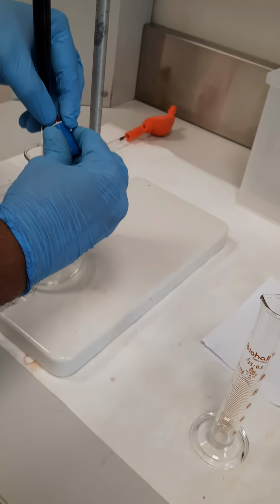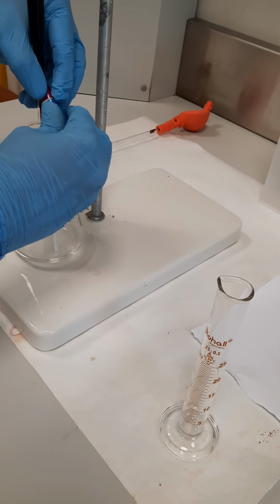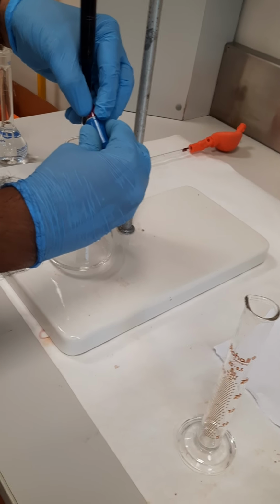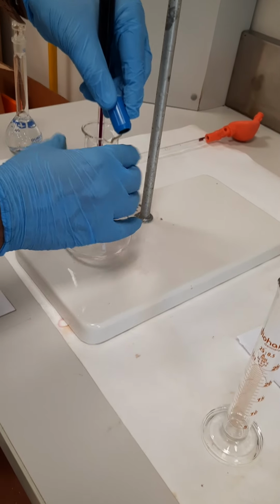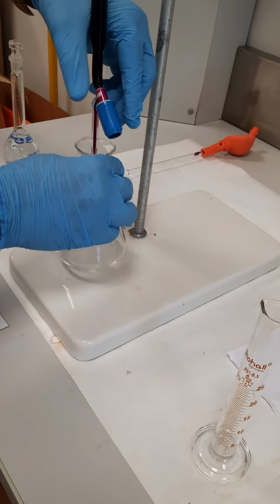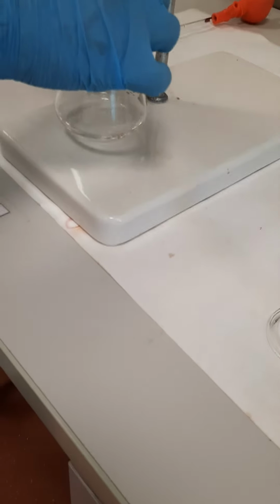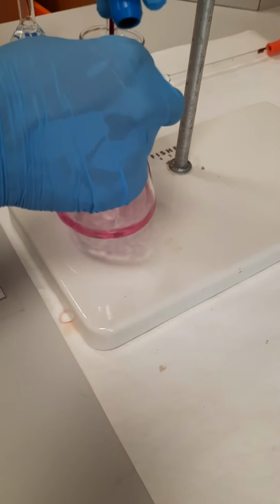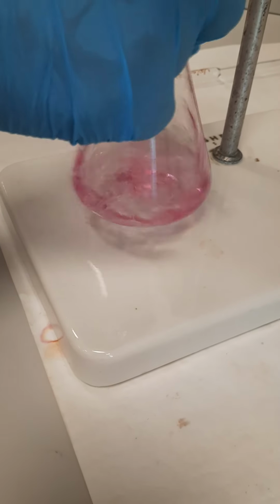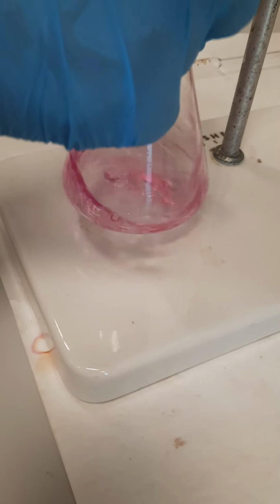There is no need for heating now, because the rate of the reaction between the hydrogen peroxide and KMnO4 is already high. We will continue the titration until we get to the end point. The end point, again, there is no need for indicator. The end point is when you can see the pink color. So here you can see now we got the end point color, and it's permanent even if we are shaking. Just leave it.